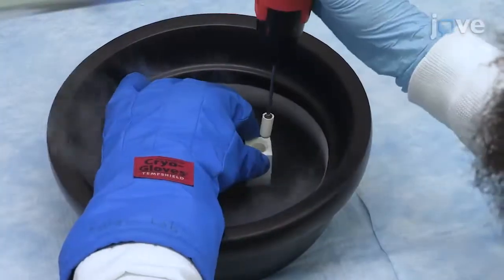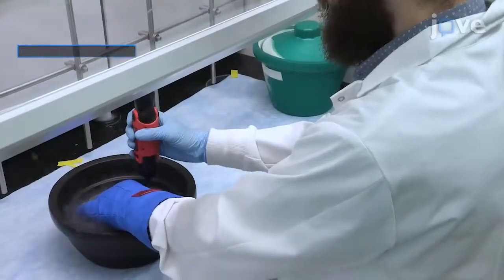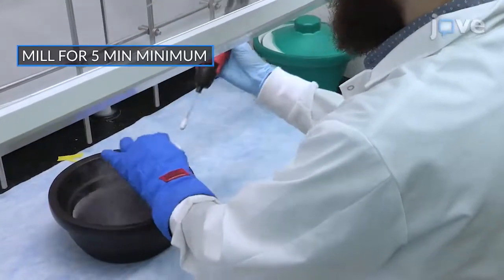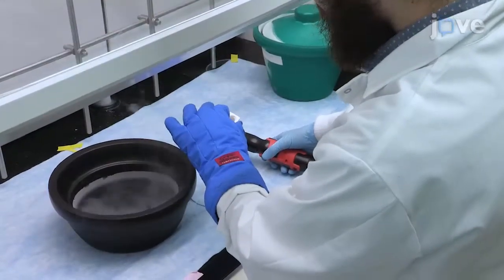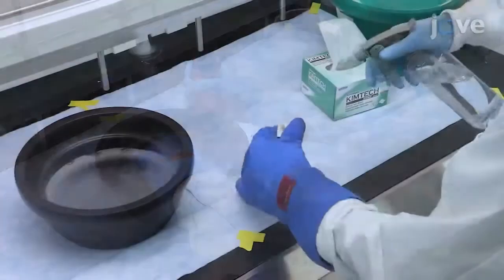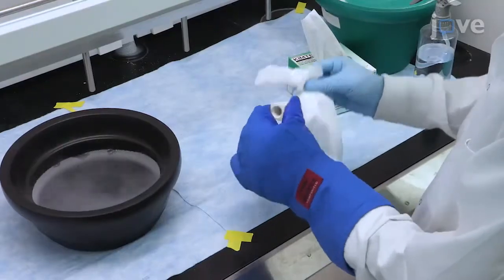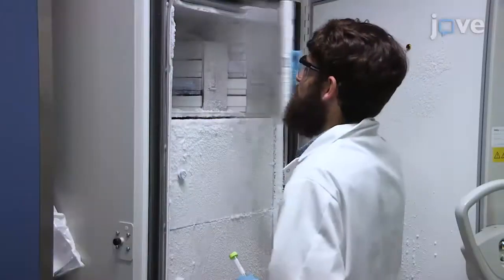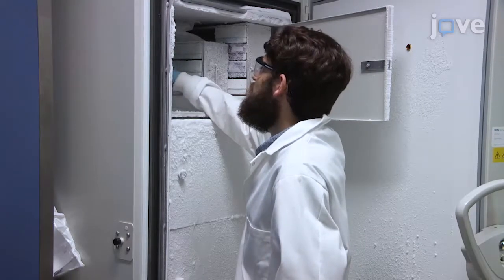Then, use a pestle attached to a handheld drill to mill the sample. Mill in 1-minute intervals to check the progress, and remove the gloved hand from the liquid nitrogen. Repeat this milling process for all samples, making sure to spray and wipe the mortar and pestle with ethanol between each sample. Store the powdered samples in 15 milliliter tubes at -80 degrees Celsius until ready to use.